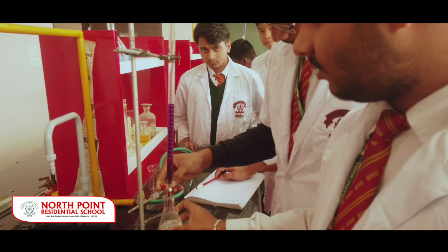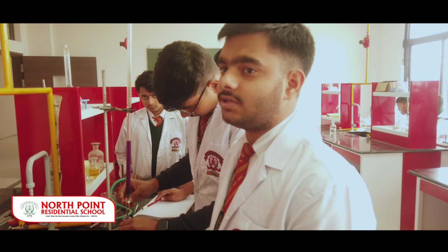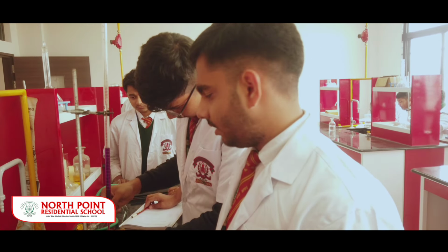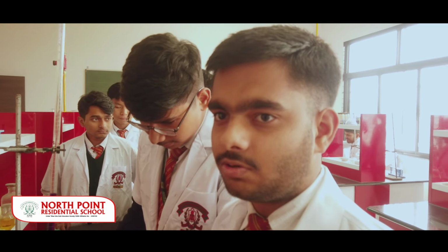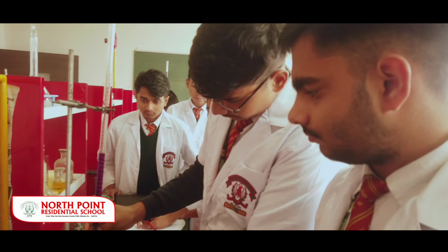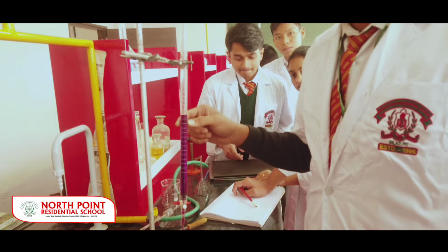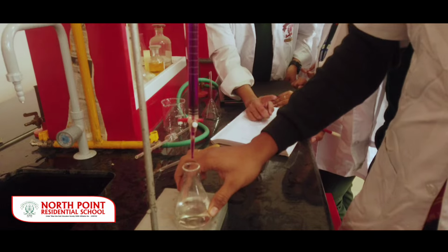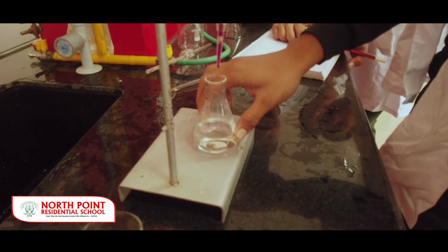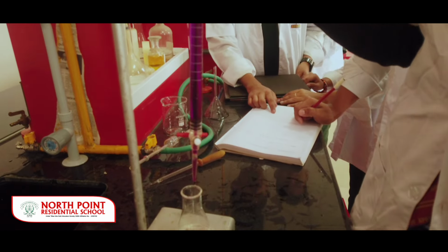And so many solutions and chemicals are there in our nature that we don't know the molarity. But by this method, titration, we can find the molarity and concentration of the given solution or any of the chemicals present in nature. All right. So if I may ask, what chemicals are we using to conduct the experiment? Here in the burette we have KMnO4 solution. And here we have Mohr's salt with dilute H2SO4. By this we can find the colorization of this titration.